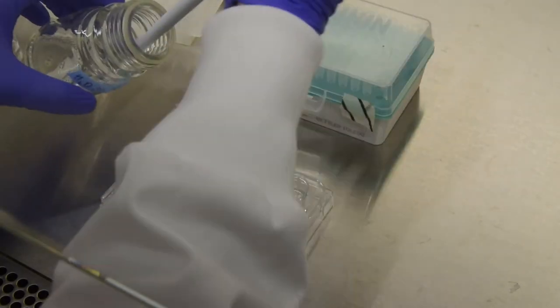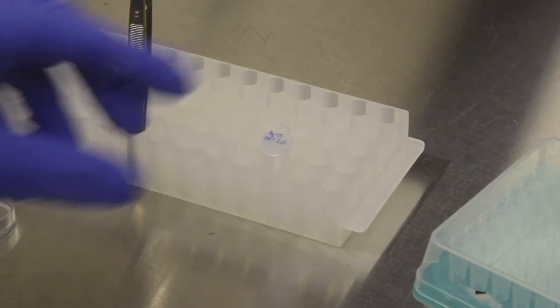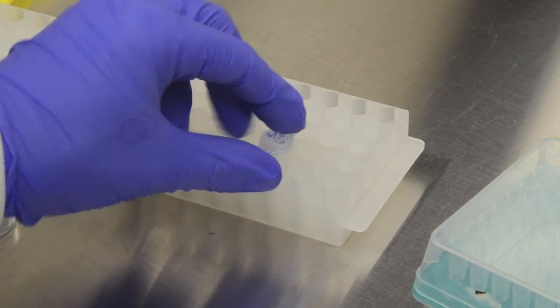Because you may have more agro lines or more yeast lines, you can do whichever you have fewer of first to reduce cross-contamination risk.